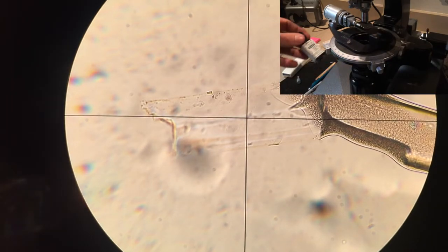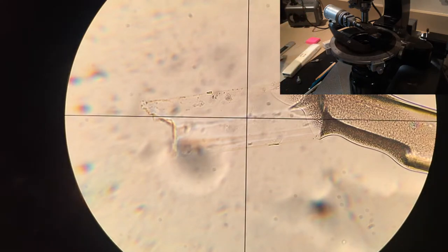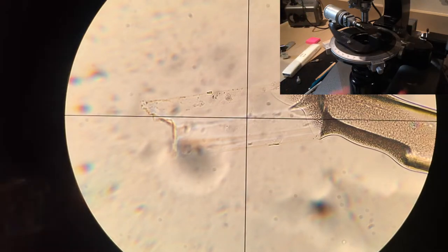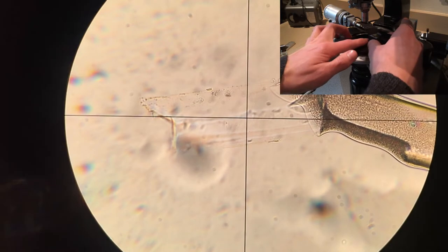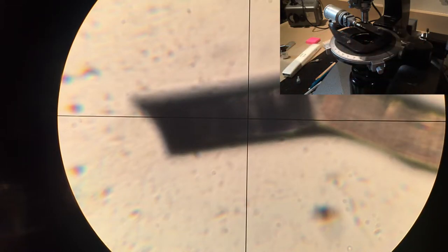I'm going to use that liquid to measure the alpha refractive index of this crystal. This is in the right orientation, east-west. Alpha is sitting in the east-west line. But I have to change the oil cell to this heating one. This has a thermocouple probe in the oil cell and it also has heating wire through it.